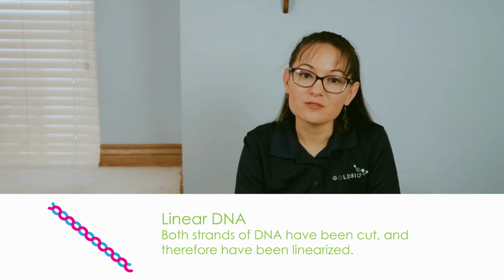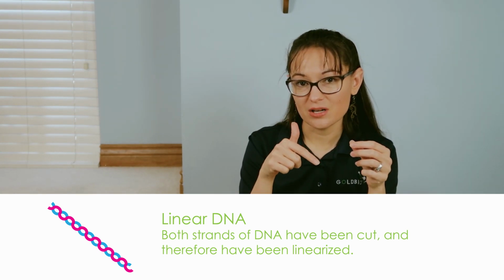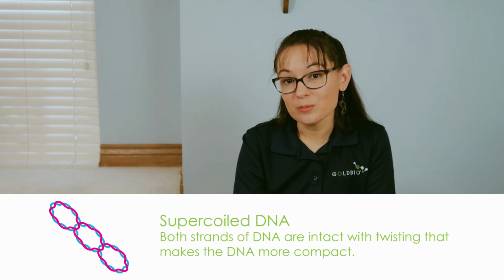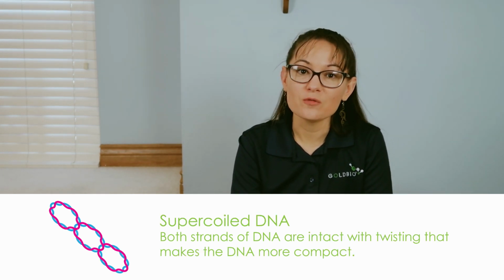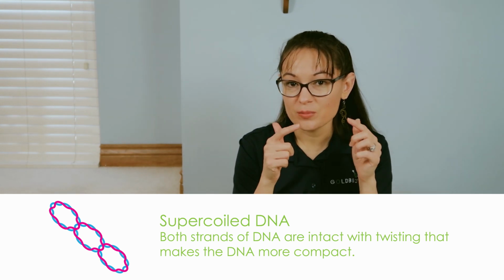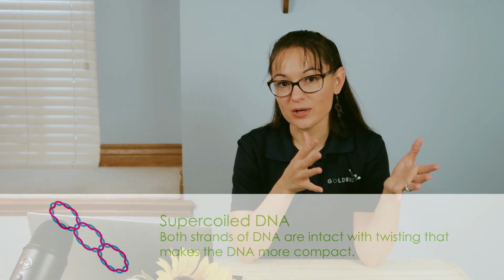The next conformation is linear DNA, and this is where both strands of DNA have been cut and therefore the DNA is linearized. And then there's supercoiled DNA, or also called covalently closed circular DNA. Supercoiled DNA is where both strands are still intact with twisting, causing the DNA to be a lot more compact. And the order of these conformations go from the least compact to the most compact, and that's going to influence how they run within a gel.